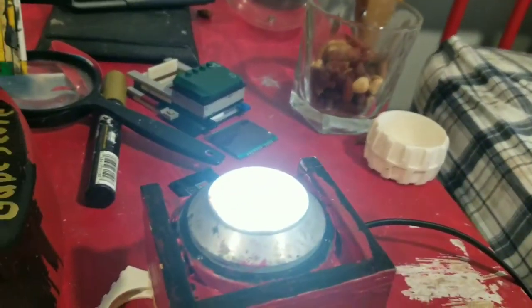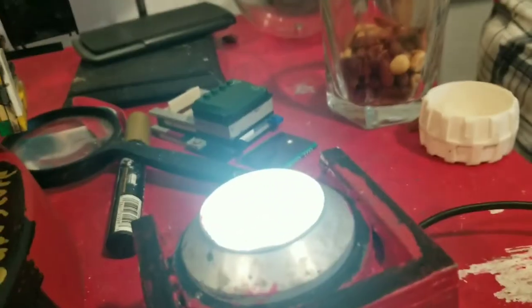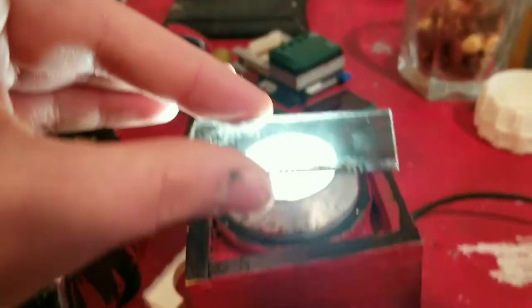Experiments here. So I've been planning to turn my microscope into a polarized light microscope for a long time. In fact, even when I built the lighting system, I added a built-in polarizer filter. However, as you can see, when you turn it, it turns black. There's a polarizer filter in there.